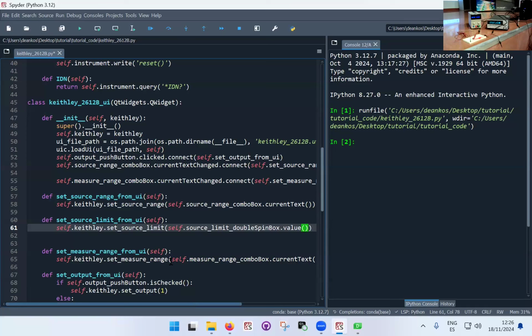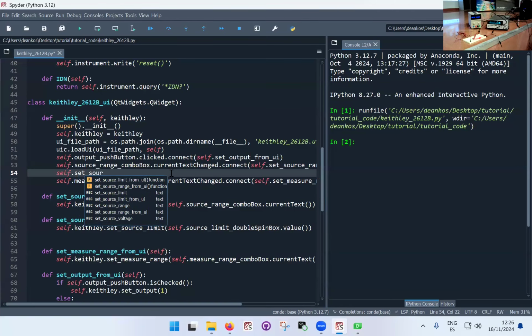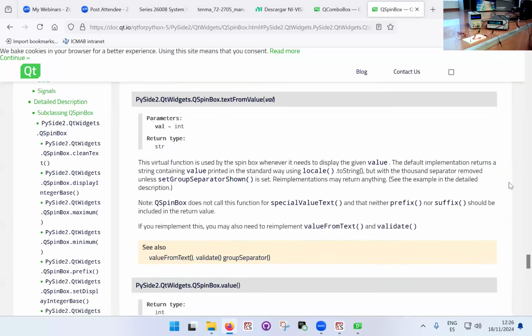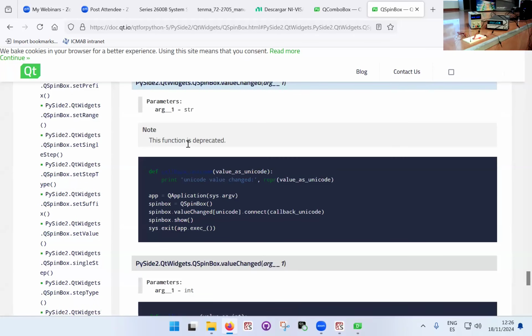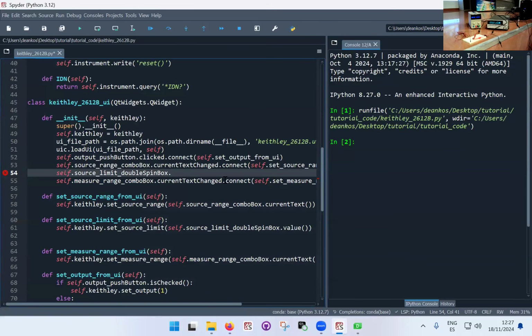So I take this value and I pass it to the set source limit function of the Keithley, and then again I need to connect it. Self dot set source limit double spin box. But I can just copy paste it from here. Dot what? When is this actually supposed to trigger something? Again, we go back to the documentation, and generally you want to trigger a change when you change the value in the spin box. So we go into the signals, value change. There we go. So when this happens, we want the function to execute.